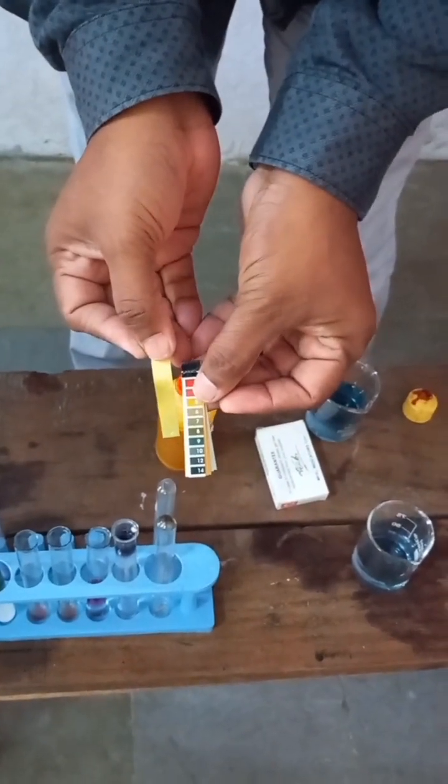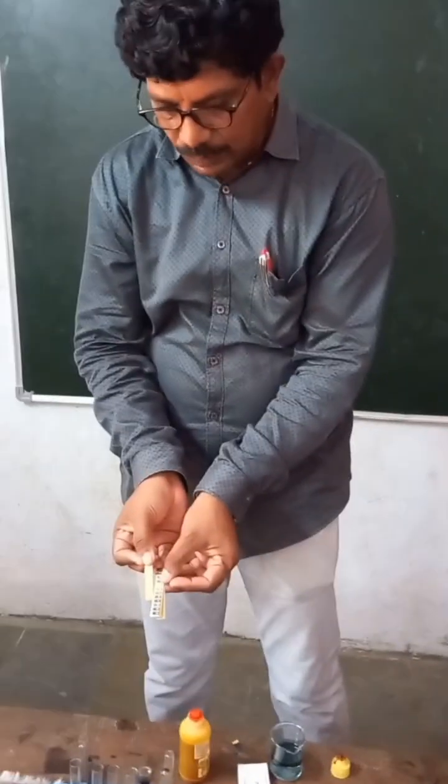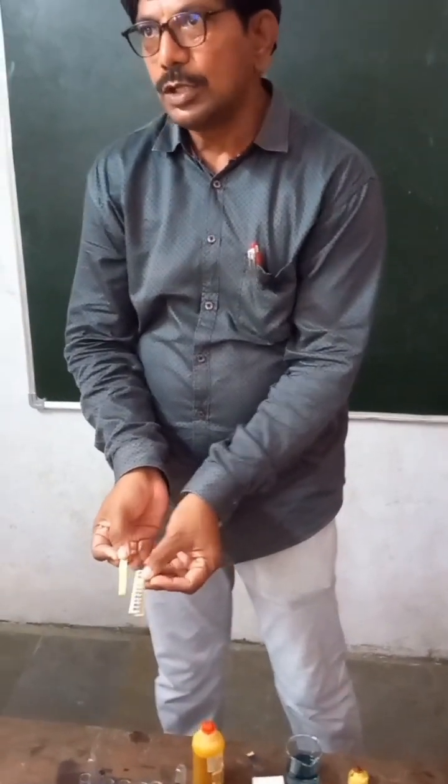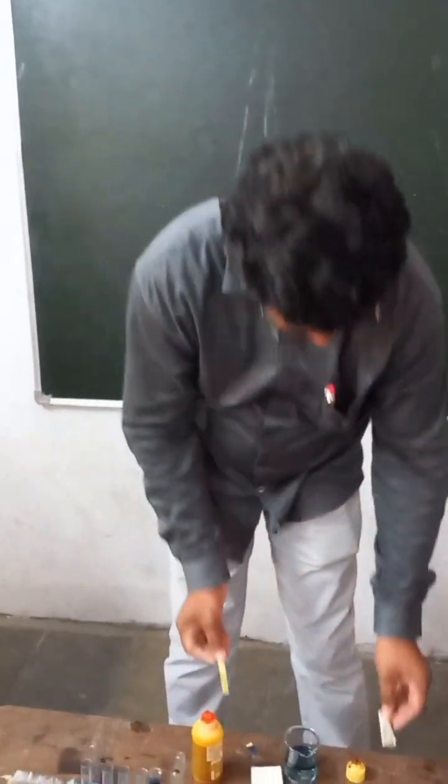The pH is between 6 and 7 — in between 6 and 7. Are you clear? The saliva pH is nearly in between 6 and 7. Are you clear? You can test your saliva also.